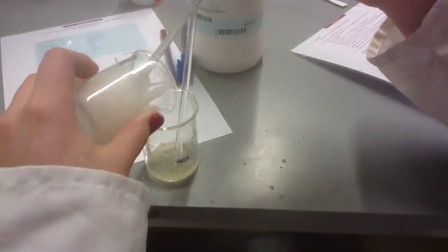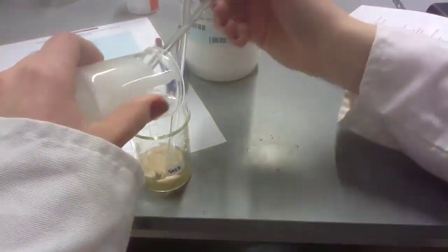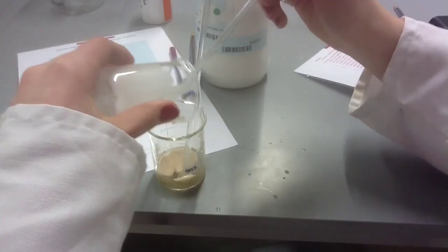Add the yeast suspension to the sodium alginate solution and mix thoroughly with a glass rod. This immobilizes the enzymes.